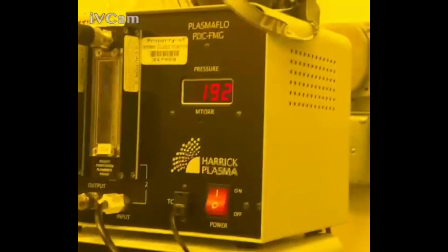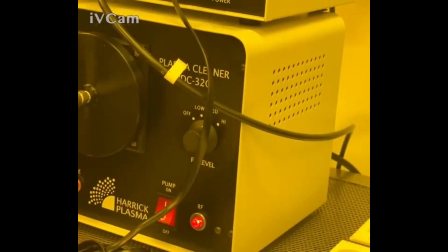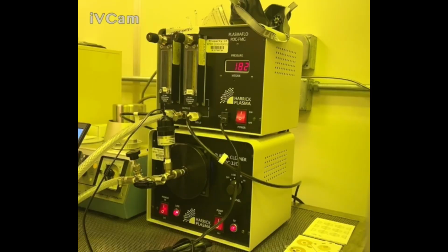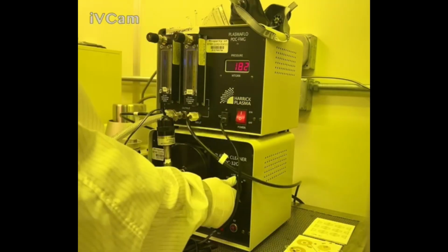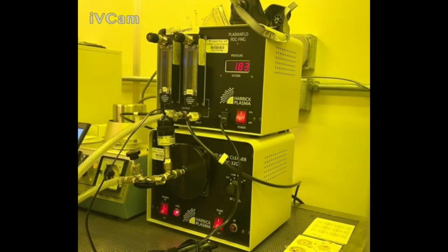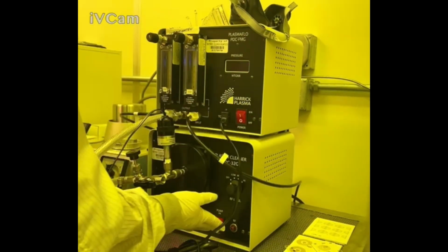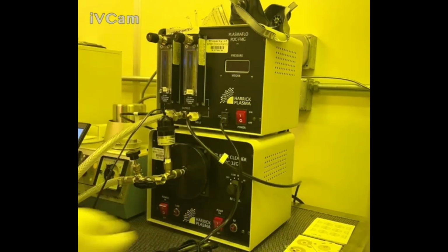And you might see the pressure change. That's not an issue, so long as you've had it flooded appropriately in the previous steps. You should be fine. So my timer's gone off. I'm going to turn this all the way off to 0. Then I'm going to turn off this one, turn off the pump, and turn the power off.